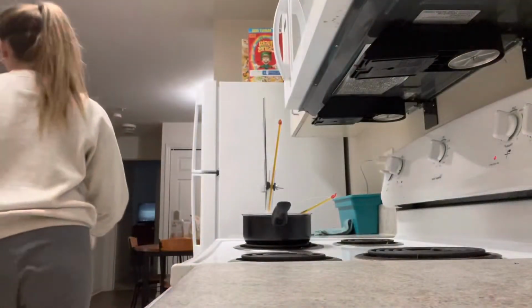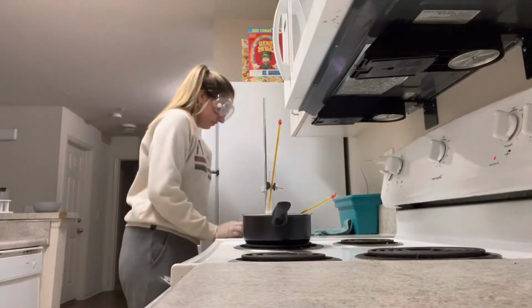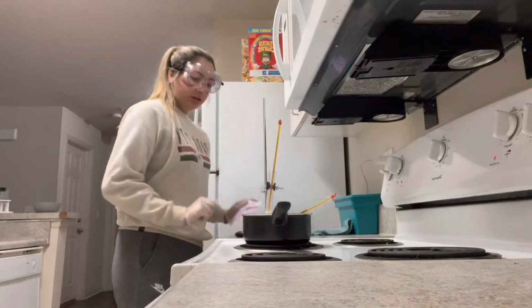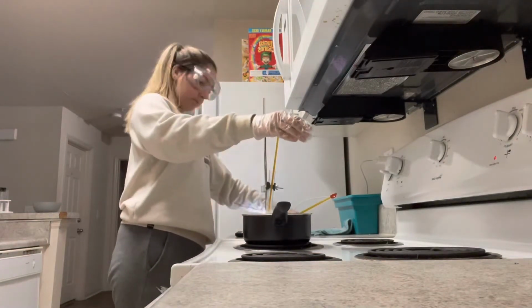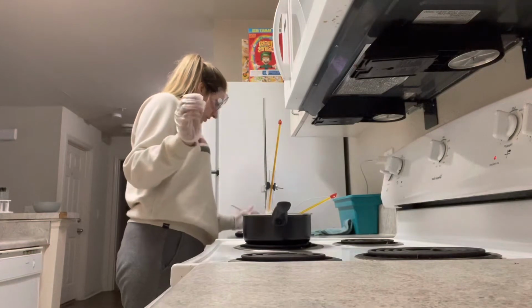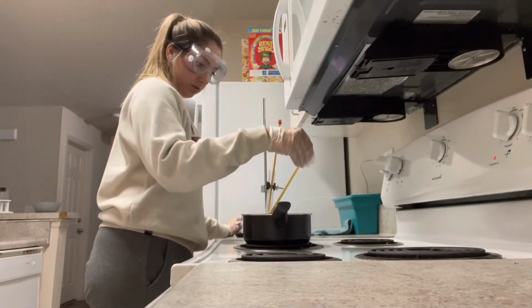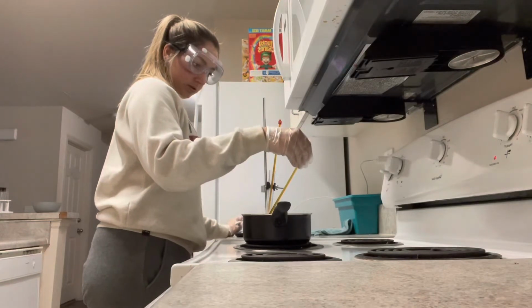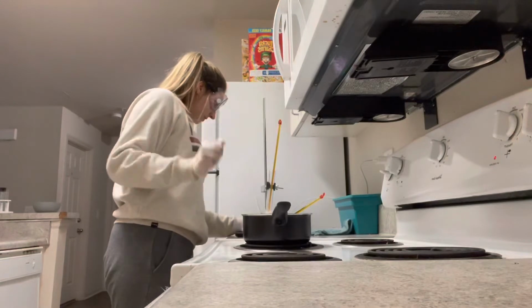Okay, so I'm going to bring this back over here, reset my timer, and currently my water is at 72 degrees Celsius.